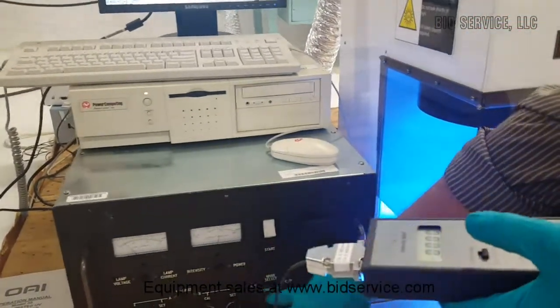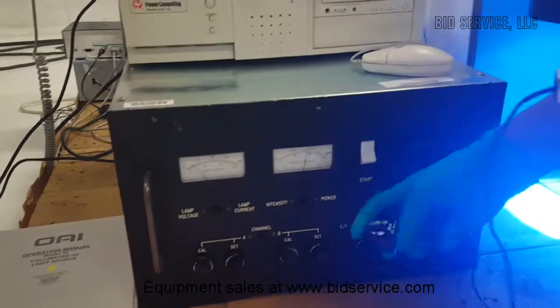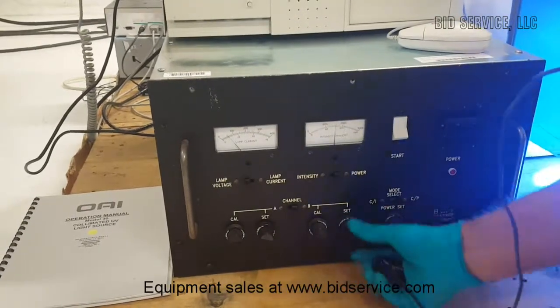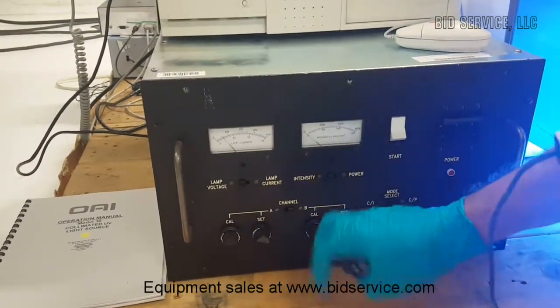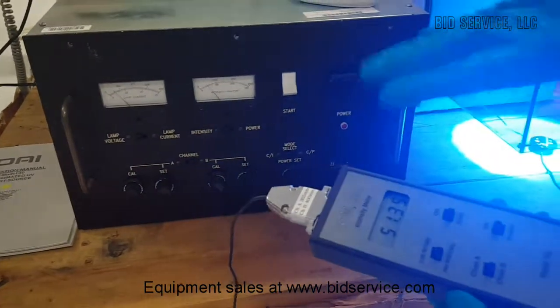And the power supply, right now I'm operating in constant power mode. It can also be operated in constant intensity mode, provided it is calibrated. So once you calibrate the intensity level of every sensor using the external meter, there is a procedure to calibrate this.